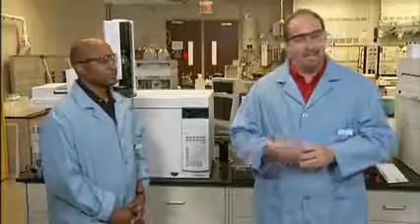But if you now have a higher concentration in the sample than you dealt with before, you may need to dilute the sample to get it into your working concentration range. It is also possible that your solvent may have something to do with the retention time shift. You'll typically see this with a splitless injection because of the reverse solvent effect. We've already talked about this in another section, so I won't repeat it here. Look for part 4 on tailing peaks to hear more about it.